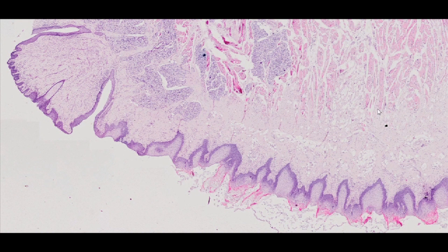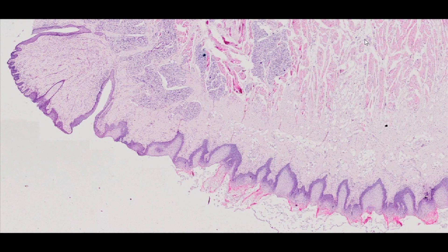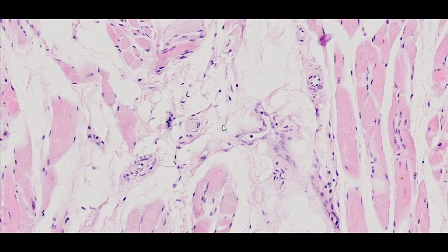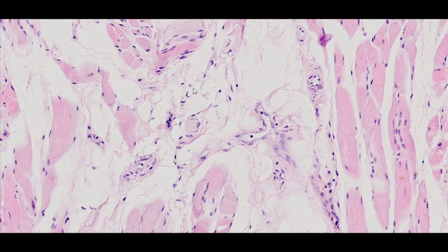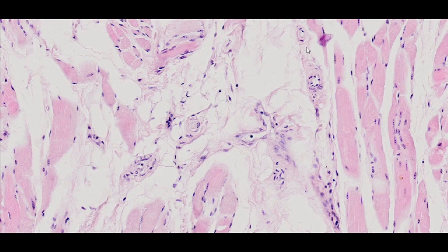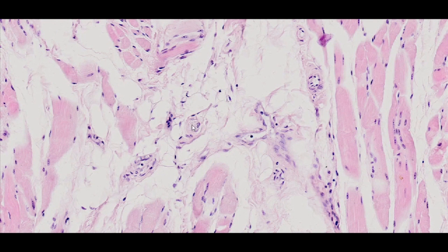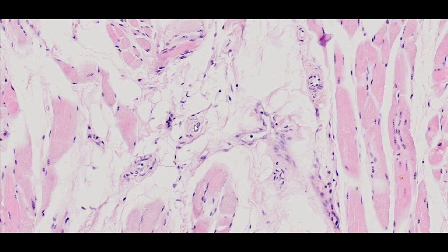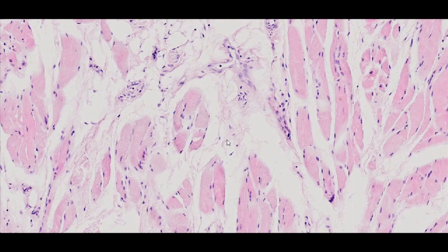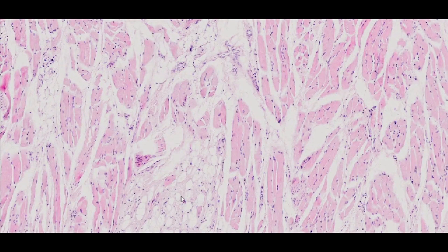Dorsal and ventral surfaces of the tongue can be distinguished. Centrally located muscle fibers are interwoven with loose connective tissue proper, rich in blood vessels and nerves. The main role of the tongue is to push the food towards the teeth, mix the food while chewing, and move it into the throat.